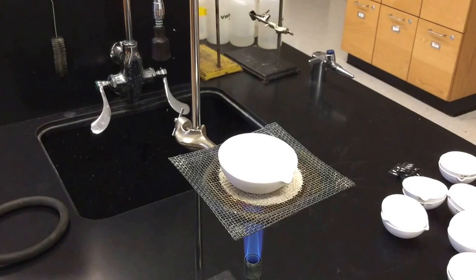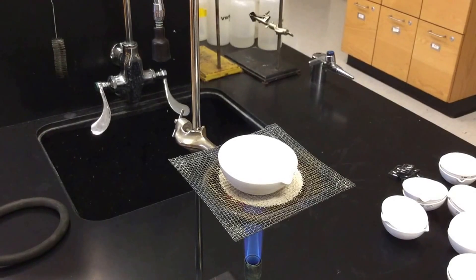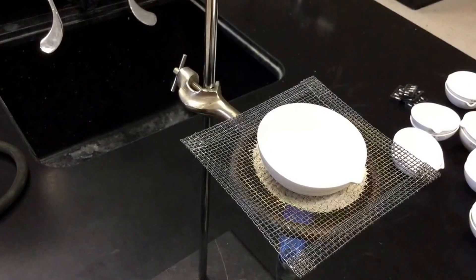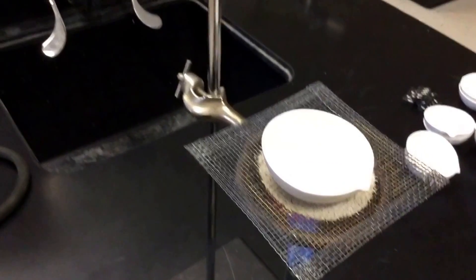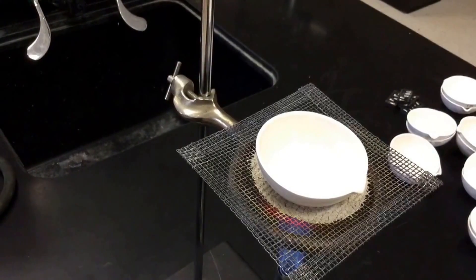Here we are, we're heating up our magnesium sulfate or Epsom salts on our Bunsen burner. And hopefully what we'll be able to see as our chemical heats up, we'll be able to see a little steam coming off. And that's going to prove that there is some water in there. What we're also going to notice as we heat this up is that the chemical itself will kind of harden. Actually, I don't know if we can see it from where it's at. Some of the magnesium sulfate is popping off, popping out of there. I don't know if you're able to see that or not. It's not picking it up too well in the light. We hear a little bit of crackling as well.